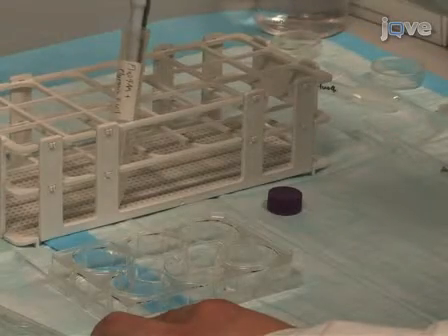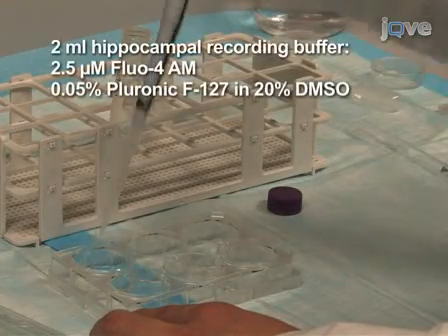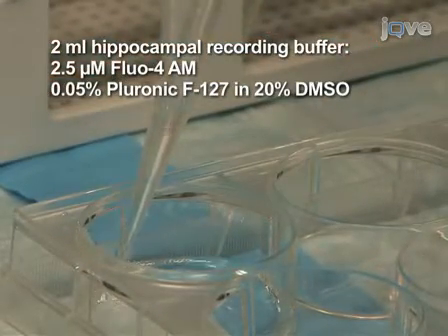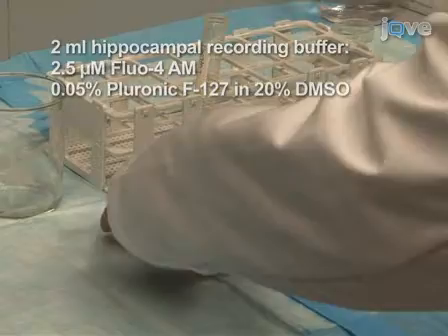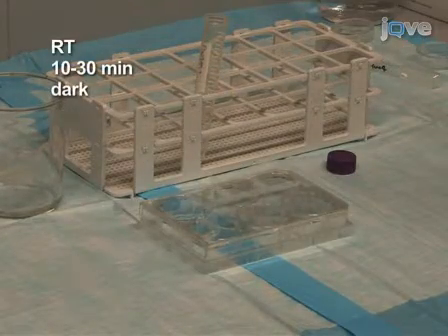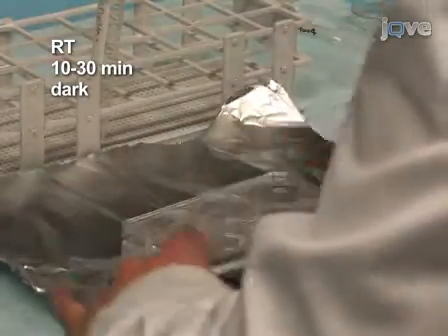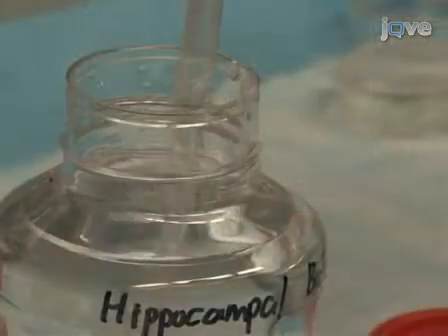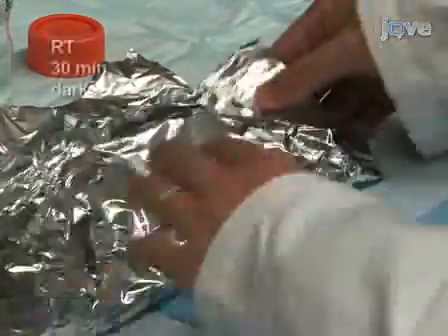For calcium imaging, place the culture in a well on a 6-well plate filled with 2 milliliters hippocampal recording buffer containing 2.5 micromolar Fluo-4 AM and 0.05% Pluronic F127 20% solution in DMSO, and incubate at room temperature for 10 to 30 minutes. Remember to cover the plate to avoid bleaching the fluorophore. Remove the Fluo-4 solution and wash the coverslips 3 times with hippocampal recording buffer. Incubate the washed coverslips at room temperature for 30 minutes.